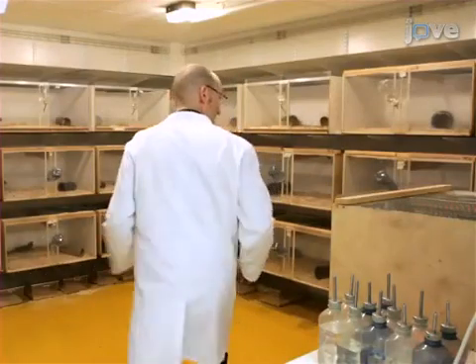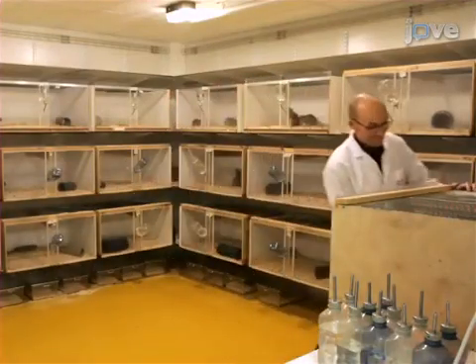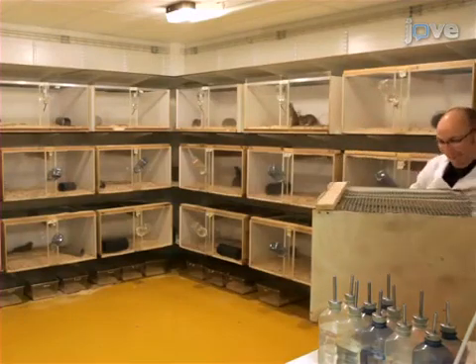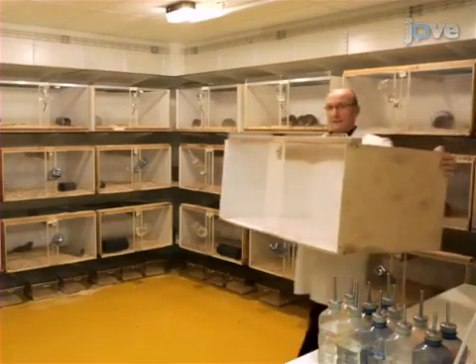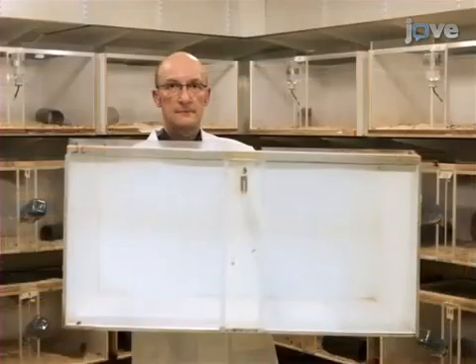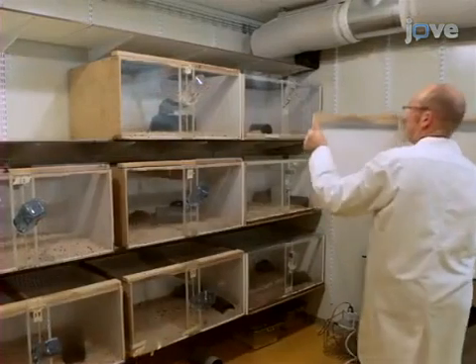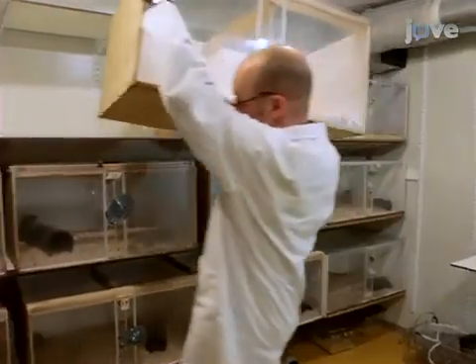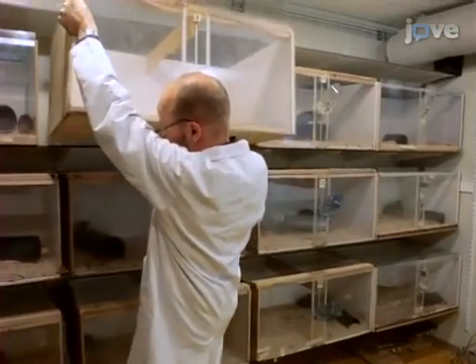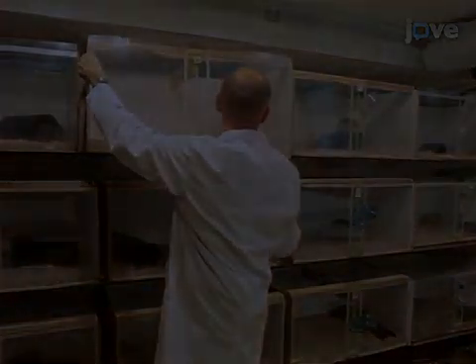Offensive aggression is a highly active behavior and therefore sufficient space is required for its full expression. For optimal results, use resident cages that have at least half a square meter of floor space. To facilitate developing territoriality and reduce social isolation, house each resident with a female for at least one week before the start of the experiment.